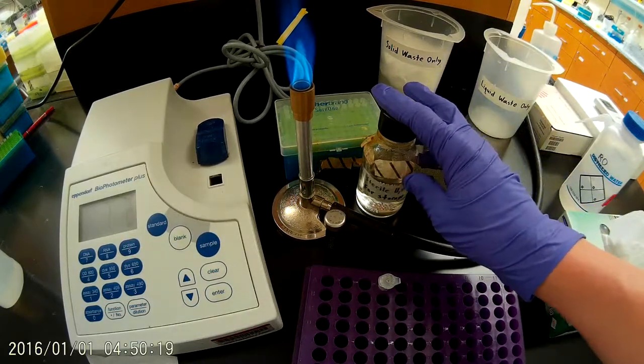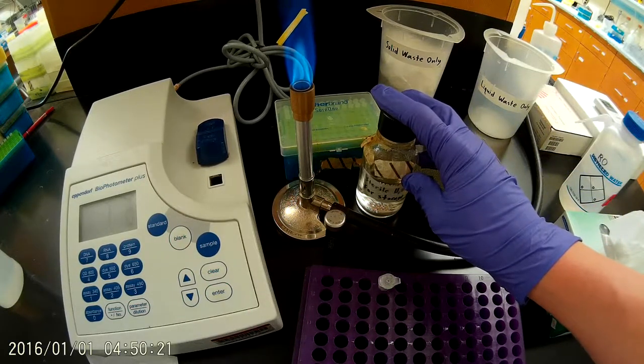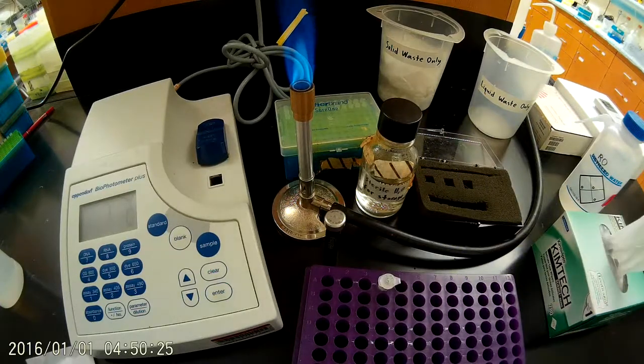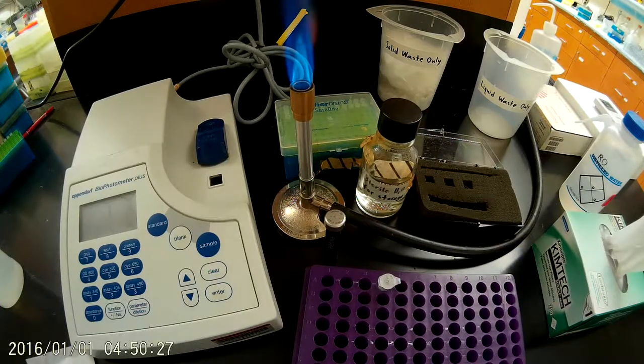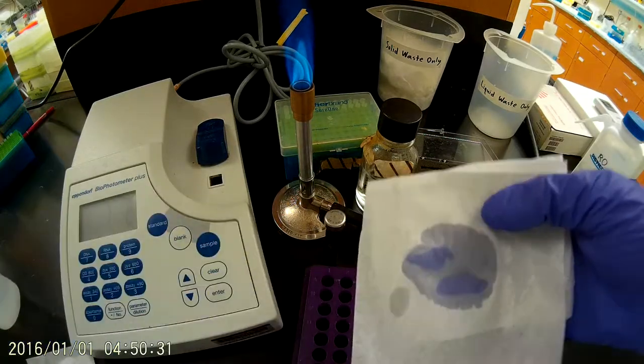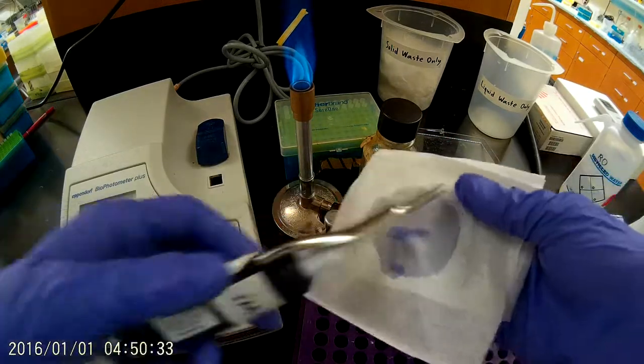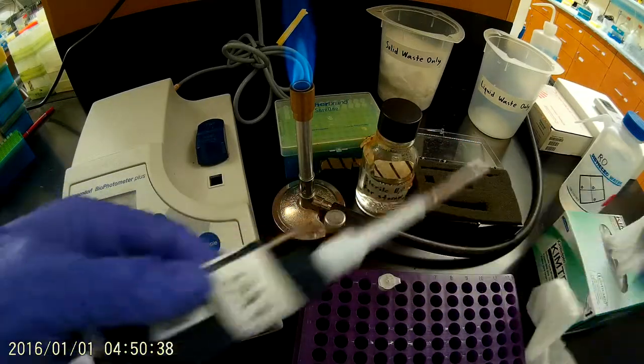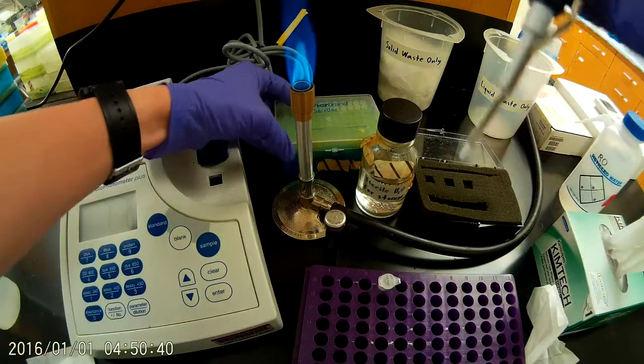So because this is theoretically sterile water and it's the water that I use to prepare all of my plasmid samples, I'm going to clean off my pipette before I stick it in there. So again, I'm going to take a kim wipe, take a little bit of 70% ethanol, and clean off my pipette barrel before I stick it down into the bottle.